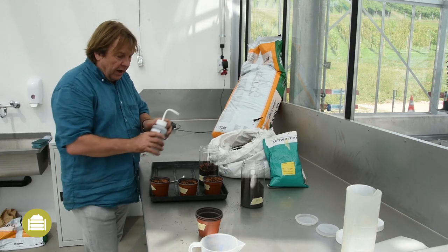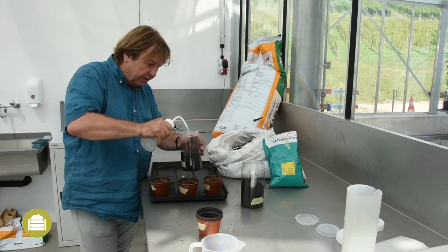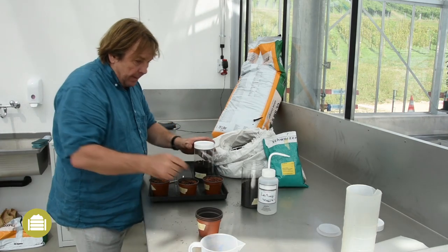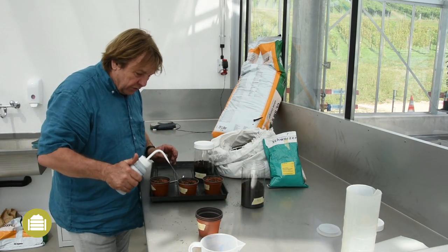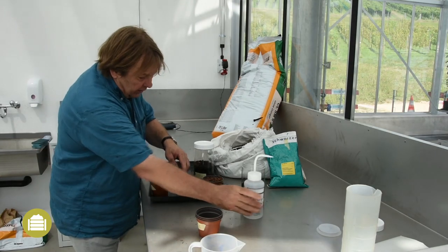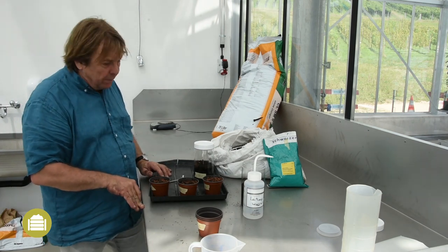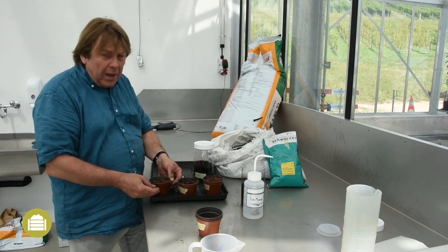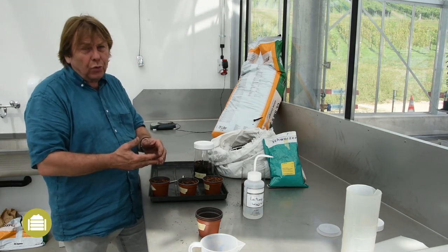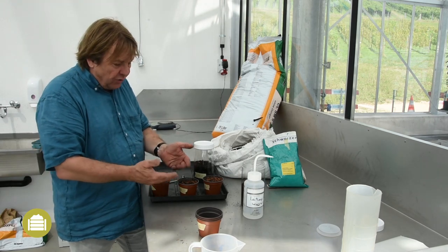Then I humidify the compost sufficiently and close the jars hermetically. The same, of course, for the open test. What is important for this test is to cover the pots with plastic until the germination of the seeds, which takes 24 to 48 hours. Otherwise the compost surface might dry out and the seeds will not germinate. This could then be wrongly interpreted as a compost quality problem.